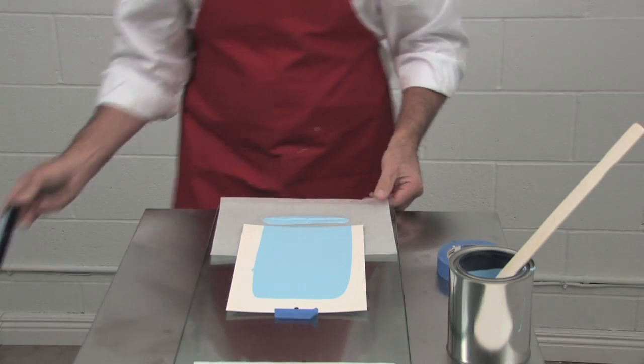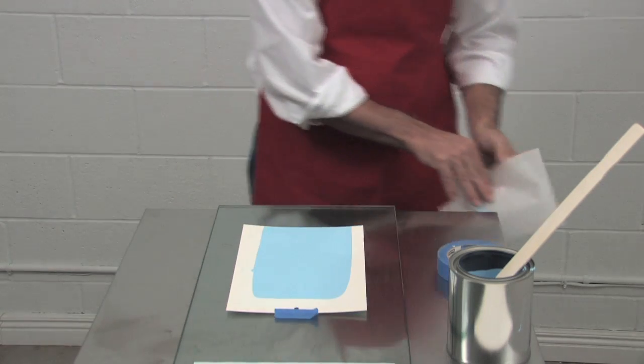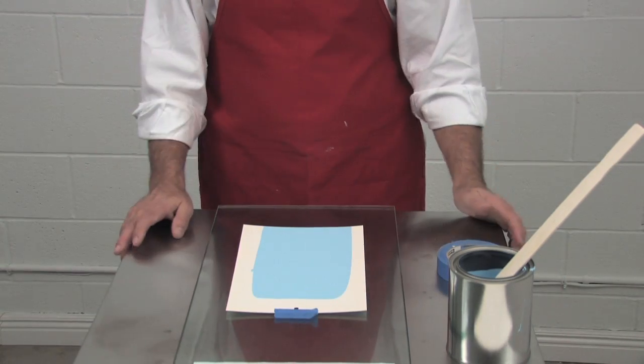Take your bar and place it in some water for washing up. Take your excess paint sheet, throw it out, and now you've made a drawdown.